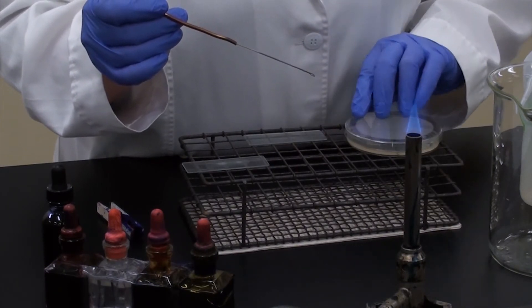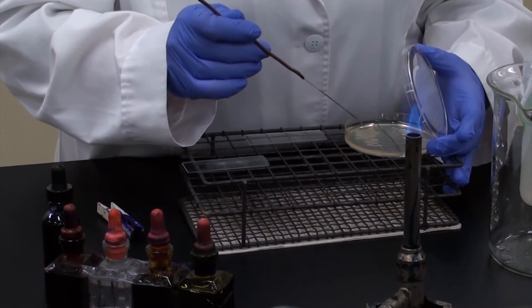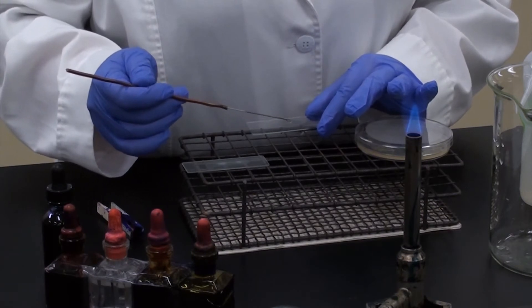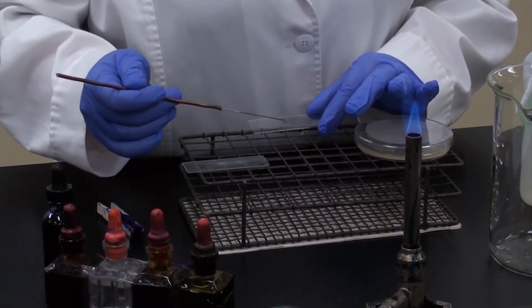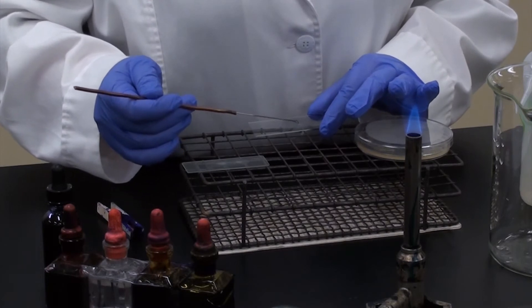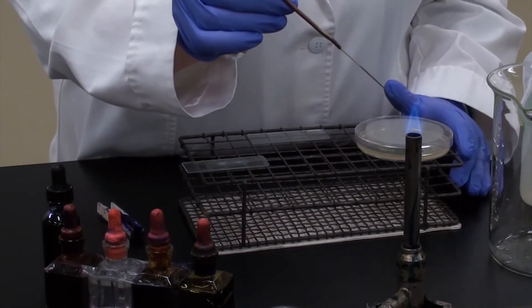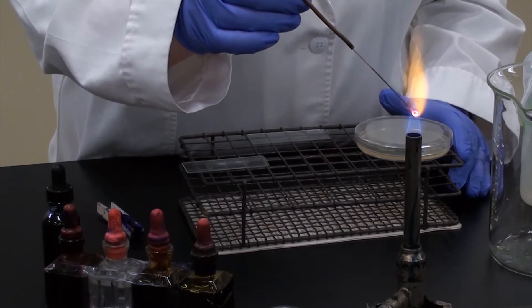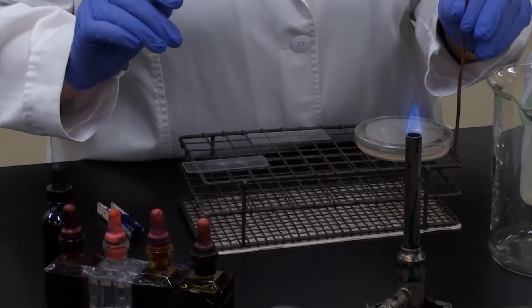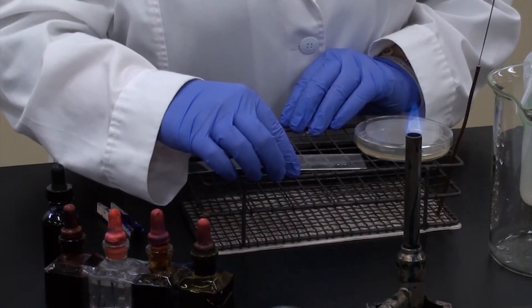I'm going to transfer a small amount of E. coli to my water droplet on my slide. You just need to touch just a tiny bit of the culture — you might think you're only getting a tiny amount on there, but you are literally getting hundreds of thousands of bacteria on that slide. I want to spread it around so that I have a nice thin colony area to see. Then I'm going to flame my loop and set it off to the side, and let your slide completely air dry until there's no longer any moisture on the slide.